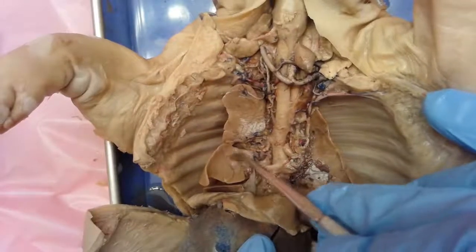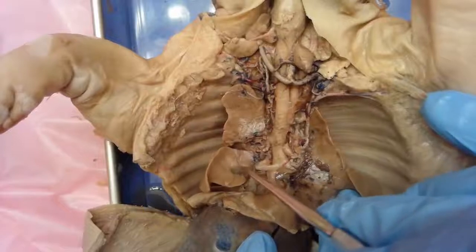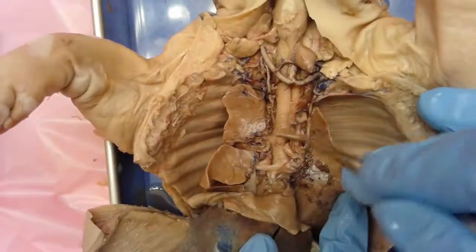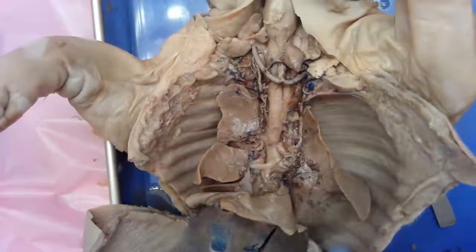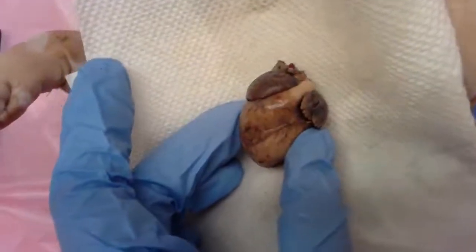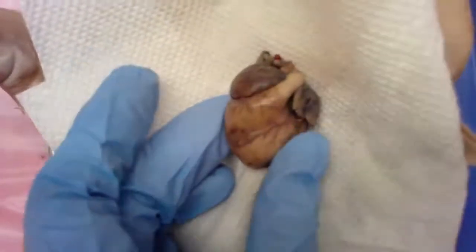And then inside of the tissues are those microscopic alveoli. That's part of the respiratory system, but with our heart out of the way, we can see that a little bit better. I want to show you some of these structures externally here on the removed heart so that we can point out the areas that we talked about and see them a little bit better and more close up.